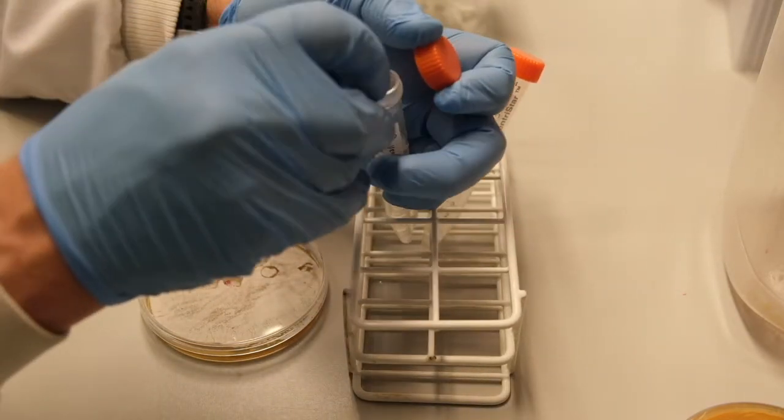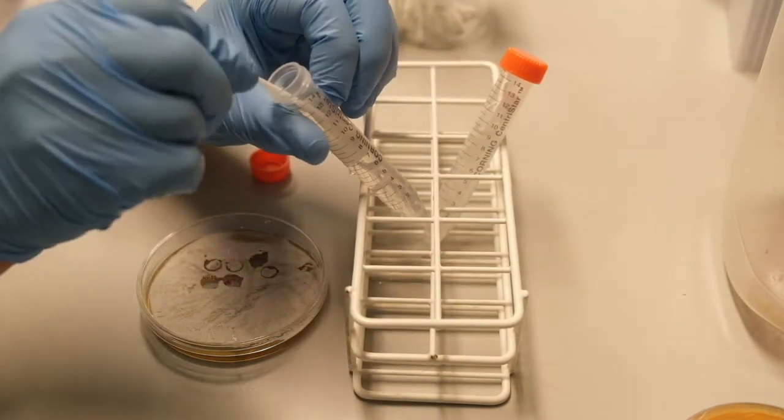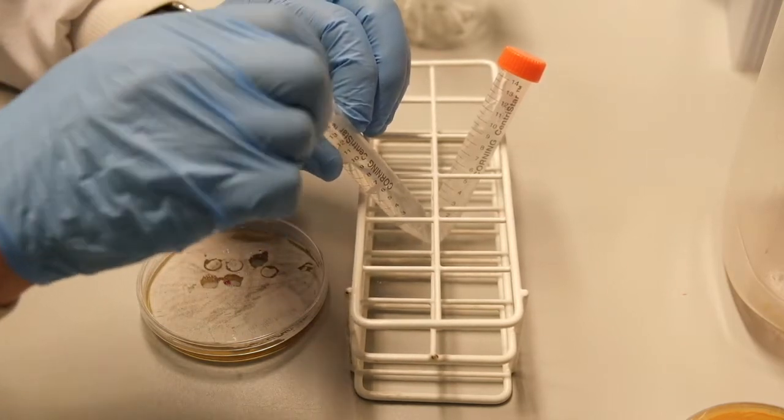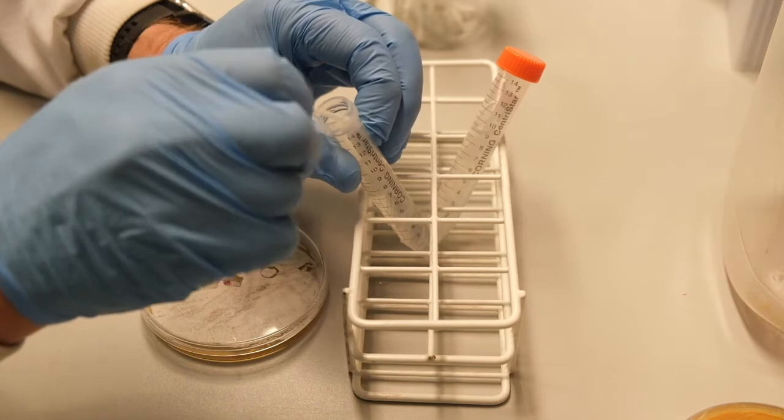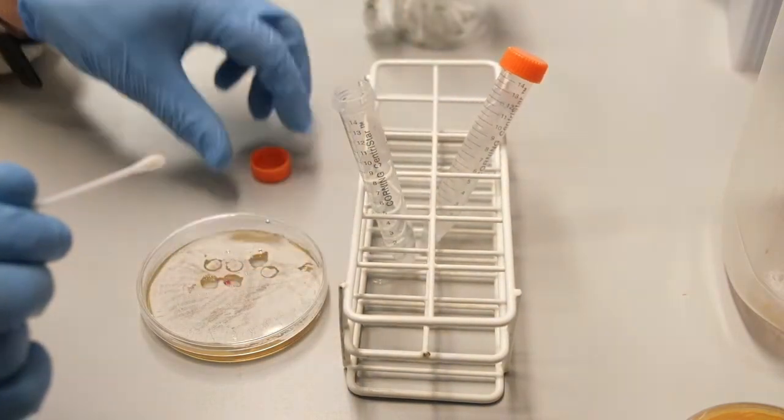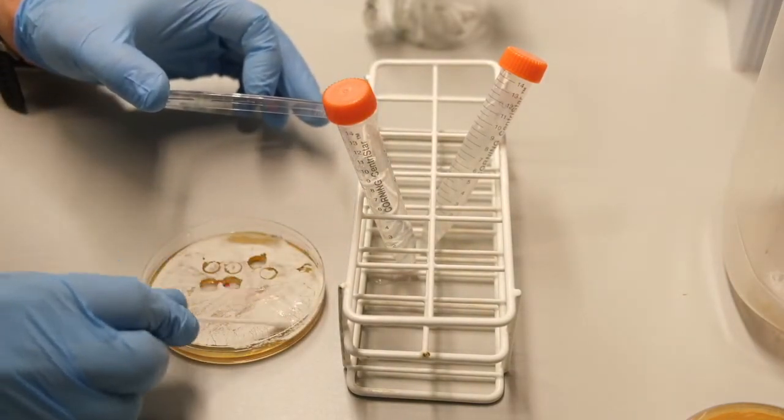Next week we will make dilutions of these spore stocks and plate to measure their concentration. We would expect these spore stocks to contain at least 10 to the 8 spores per milliliter. Spore concentrations may be as high as 10 to the 10 or 10 to the 11 spores per milliliter.